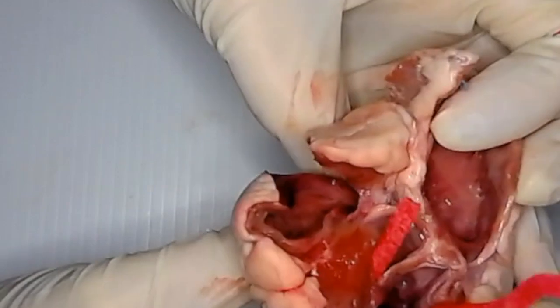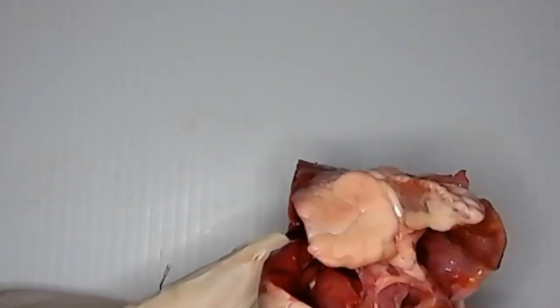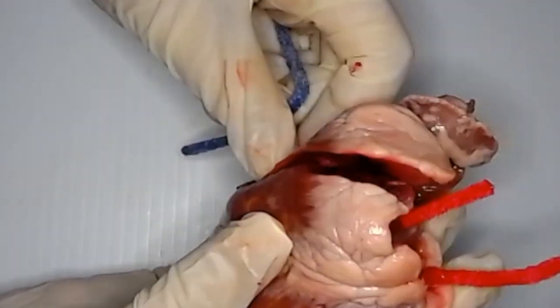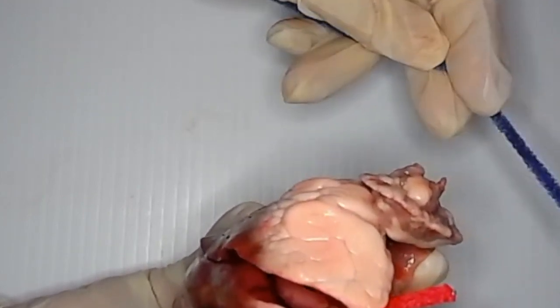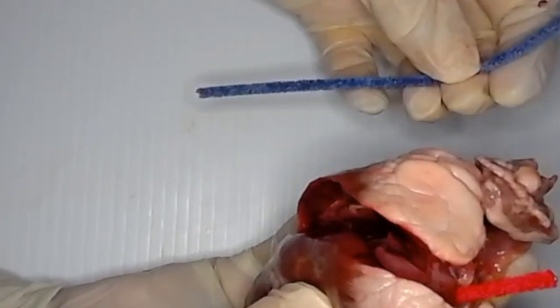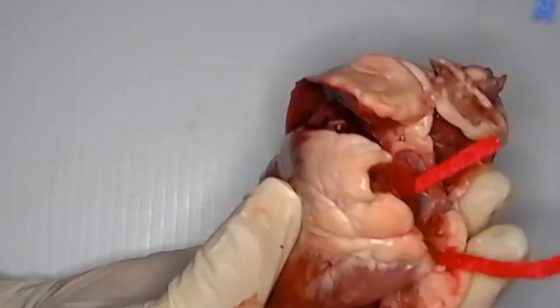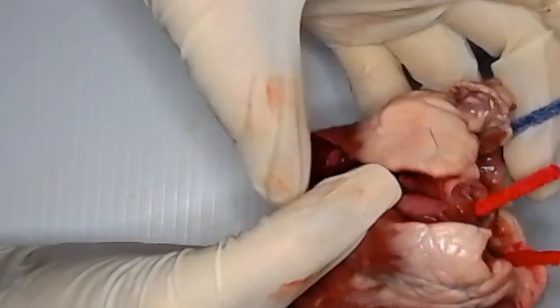Okay, so let's have a bit of a walkthrough of what happens to the blood. So blood has been all around your body, and all the oxygen within your blood has then diffused into cells, because cells need oxygen. The blood that's now coming back to the heart does not have a lot of oxygen in it. So I'm going to represent that with a blue pipe cleaner. And that's going to go in here in your right atrium.